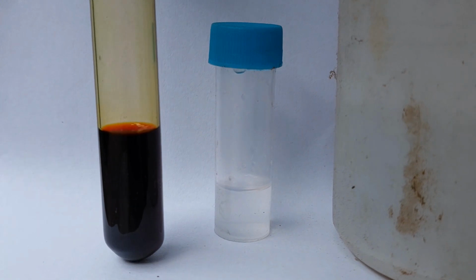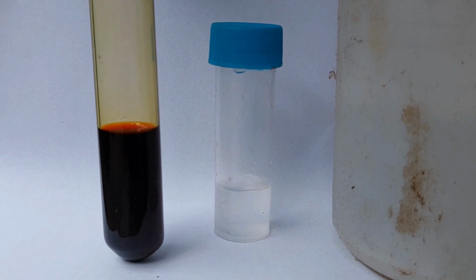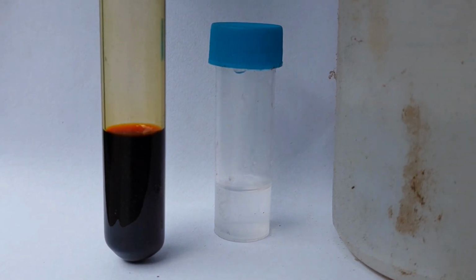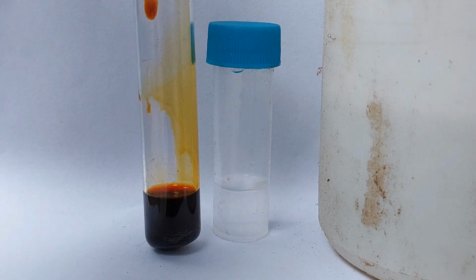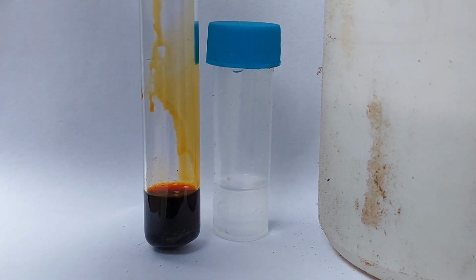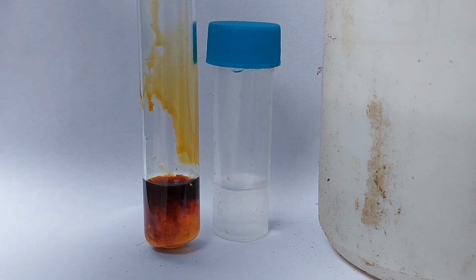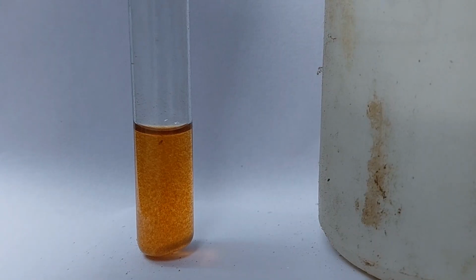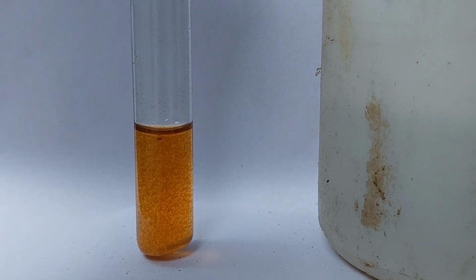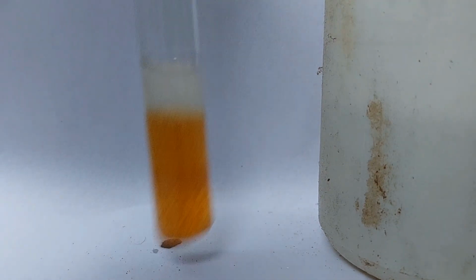So let me proceed. So at first we will have to add the dilute NaOH solution to the I2-KI solution in a dropwise manner, and it will cause to form NaOI, and this will be our oxidizer if needed. In this medium the reaction proceeds, and I have shown you the reaction mechanism before, so I guess you can relate it. Always use a clean dropper for the dropwise addition of NaOH. The mixture is shaken afterwards. Using another clean dropper, dropwise addition of acetone was performed. The mixture is shaken gently.